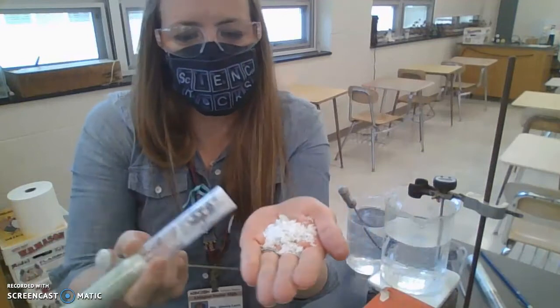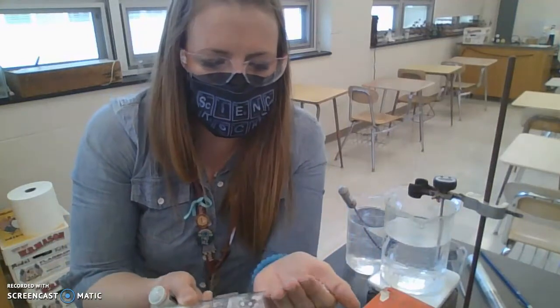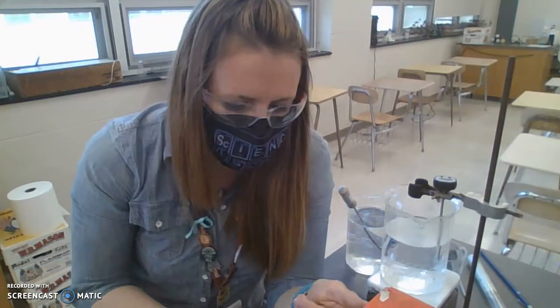It has the consistency of solid bar soap, very similar to candle wax, and is a solid obviously at room temperature right now, which is 22 degrees Celsius.